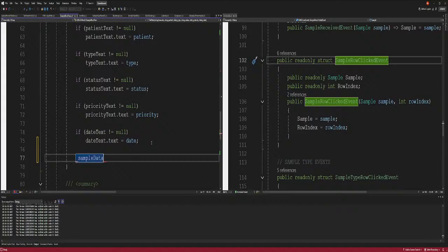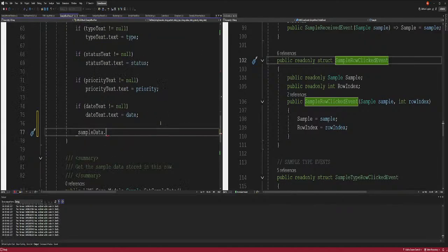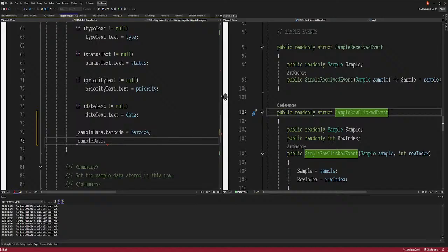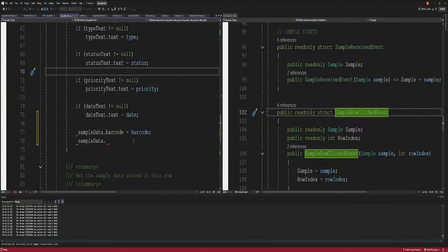Sample data, let's see. We'll go one by one. Barcode first. We do barcode first. Barcode equals barcode. Yeah, this is silly, but you know, you've got no choice. Sample. Don't fight the code. Go with the code, type of thing. Let me see what's this. What's next? Patient.